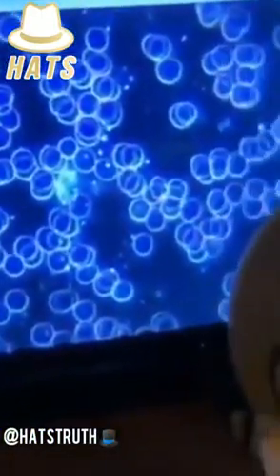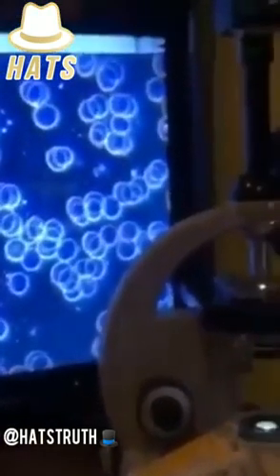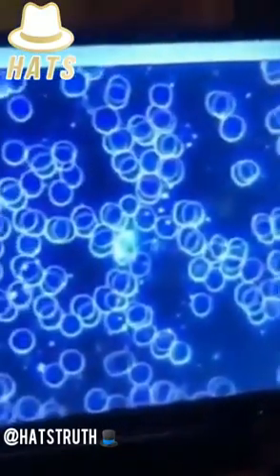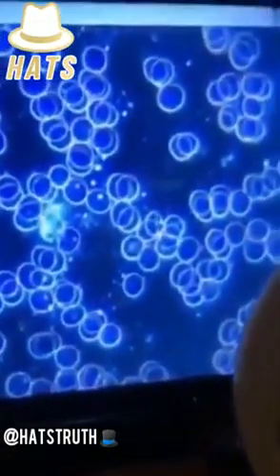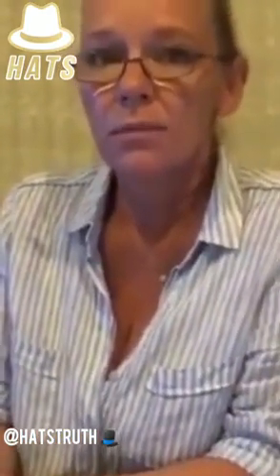So what is also important is that the serum space is clean like here, so there shouldn't be any things like what you will see soon in the vaccinated people. So we found very strange stuff in his blood, which I haven't seen in 30 years doing microscopy. So when did your patient come in? This client, when did he come in, and when did you test his blood, and what vaccine did he get?